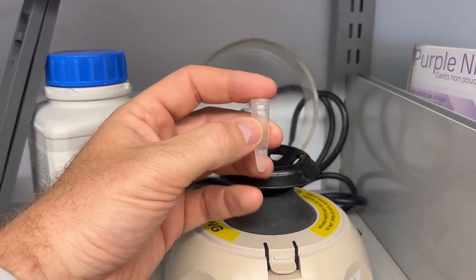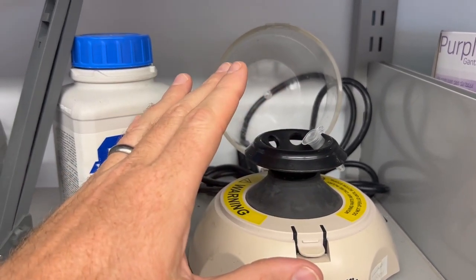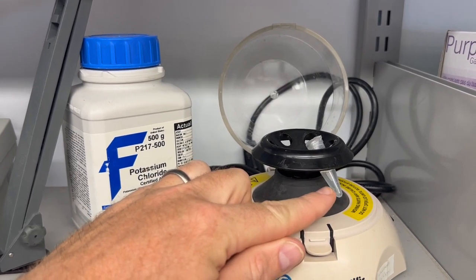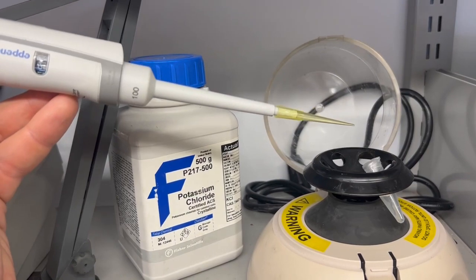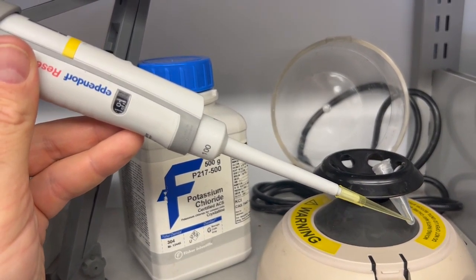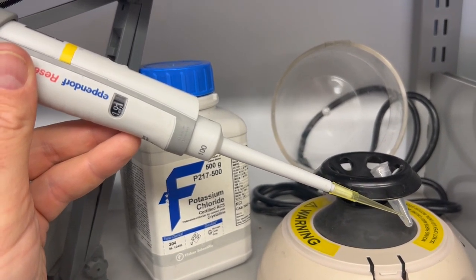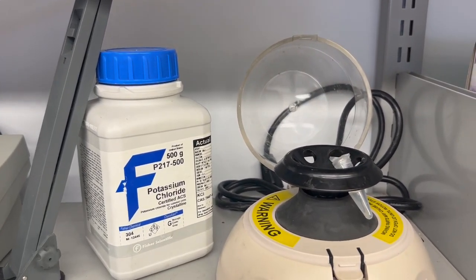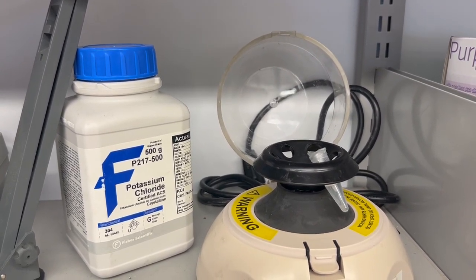So you would suspend your particles in here, and then you would centrifuge it until the particles create a pellet at the bottom, and then you would use a pipette to suck out all of the liquid except for the pellet that remains, as much as you can without disturbing the pellet. Suck out all the liquid, and then you add back the liquid that you have created, the liquid that you want to use.